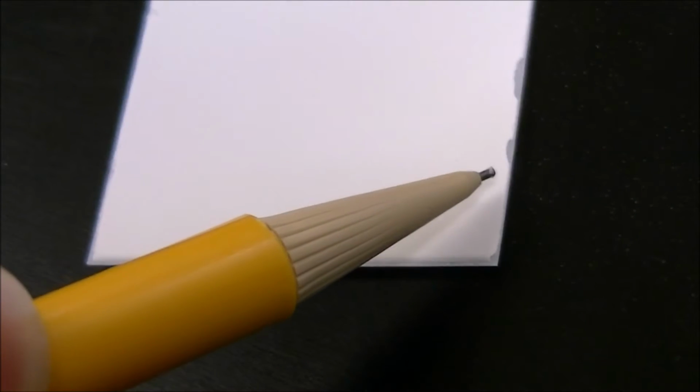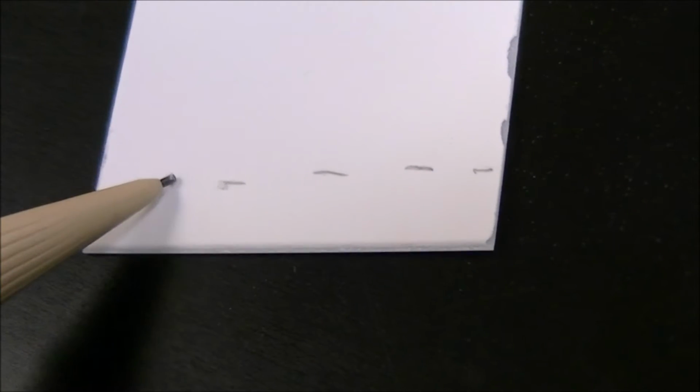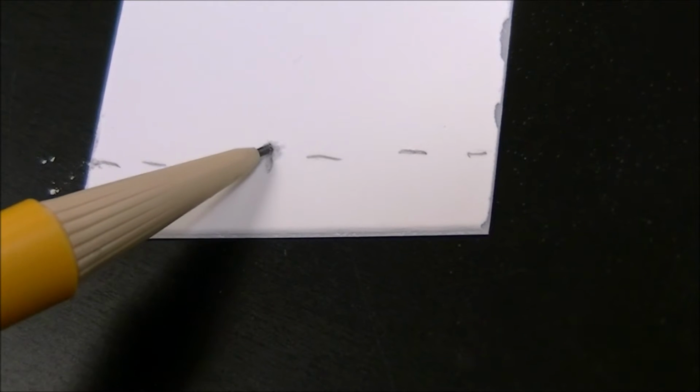So what you're going to do to set up your TLC plate is you're going to make a dotted line about 1/2 centimeter from the bottom. Then you're going to make 5 tick marks corresponding to our 5 solutions. The unknown always goes in the middle, and then the other 4 will go on the sides.